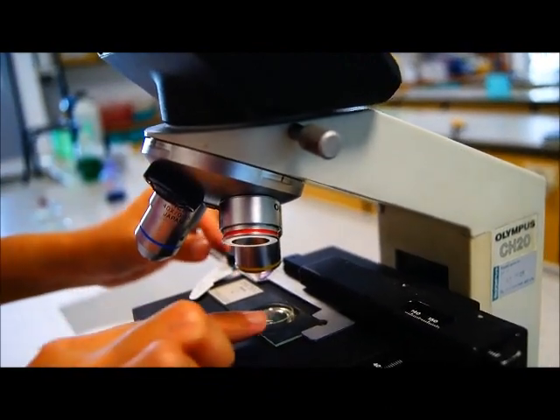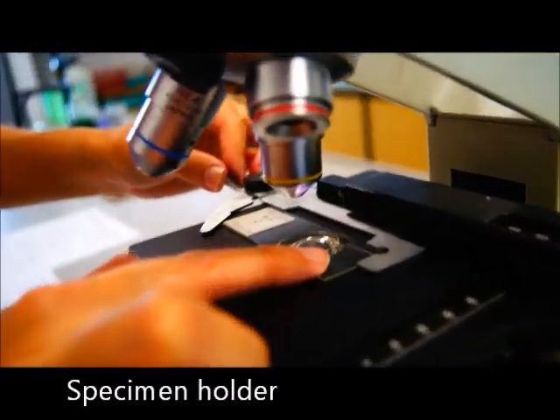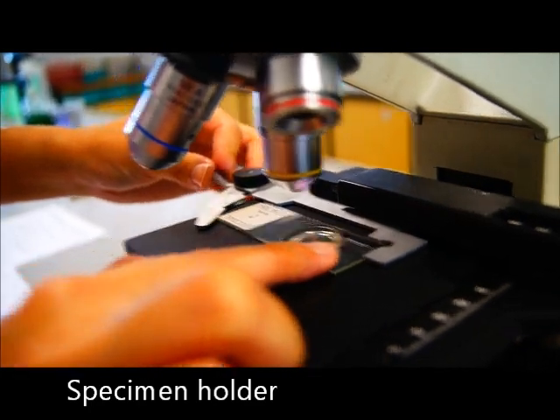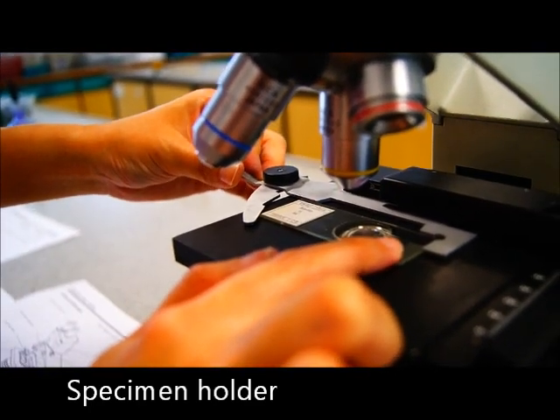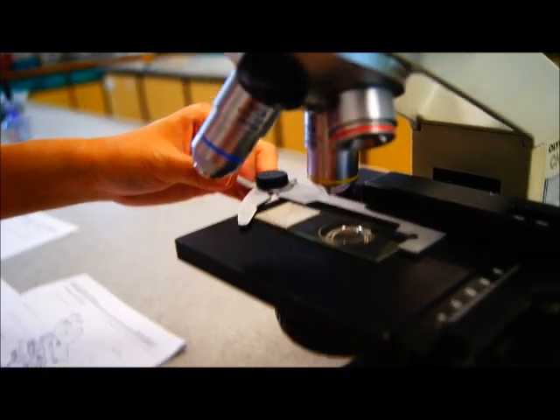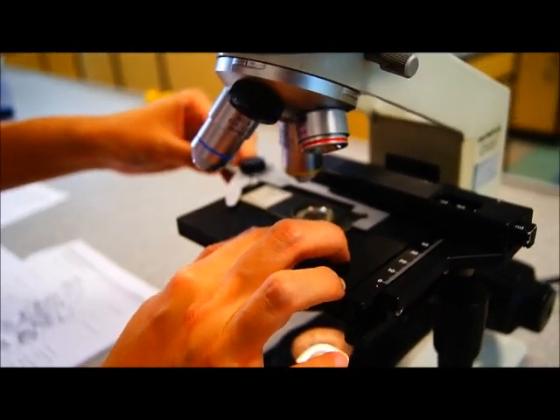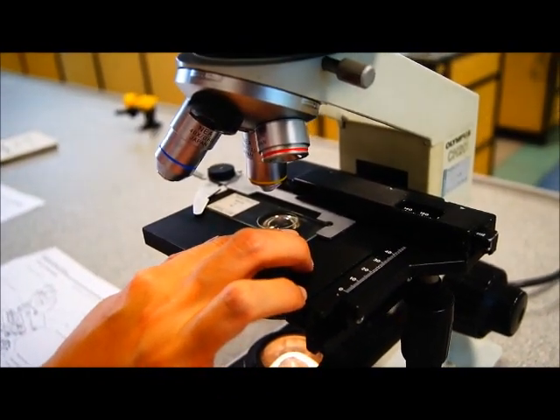Next, you have the very important specimen holder. There's a clip basically to hold the specimen in place and later on when you want to move the slide, you can adjust certain knobs which I will show you soon.